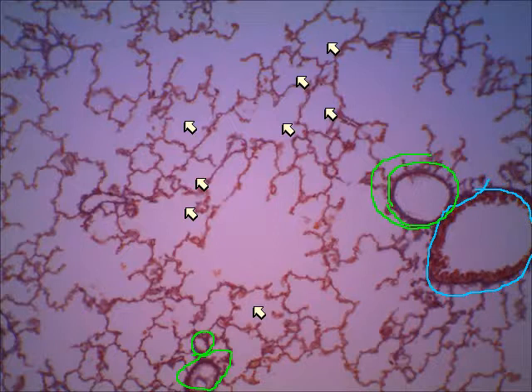All right, so the one I circled twice, that would be a blood vessel I might ask for a test question. So make sure you can find the bronchiole, the air sacs, and these larger of the blood vessels.